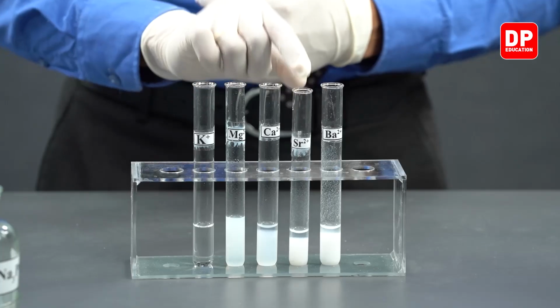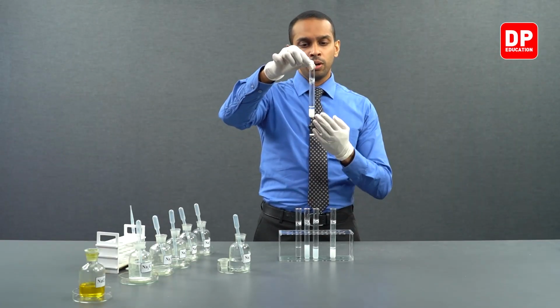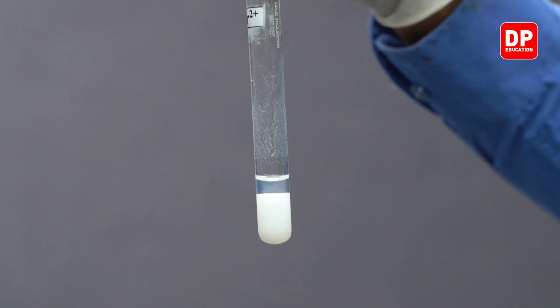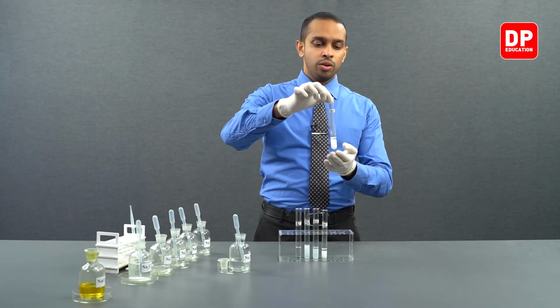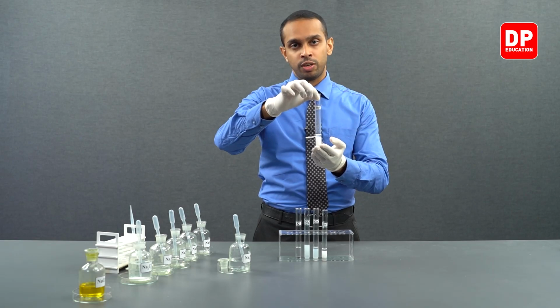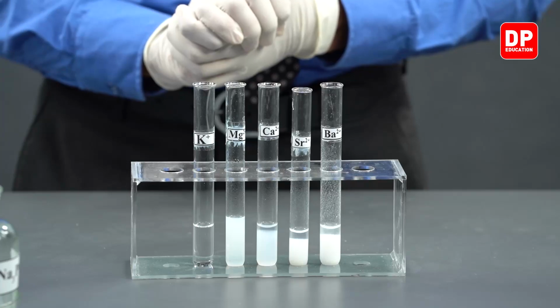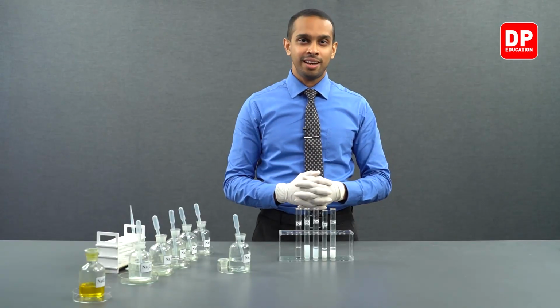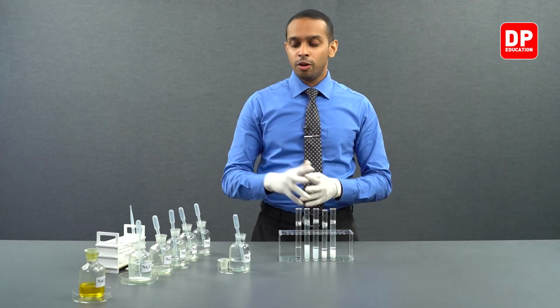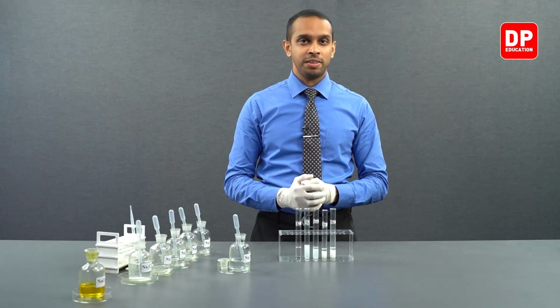When you took strontium 2 plus ions and reacted with phosphate anions, it formed a white color strontium phosphate precipitate. And finally, we took barium 2 plus ions, reacted with phosphate and formed barium phosphate precipitate. All these precipitates that are formed in the group 2 cations are water insoluble and white in color. That is how phosphate anions react with the cations we have in front of us.